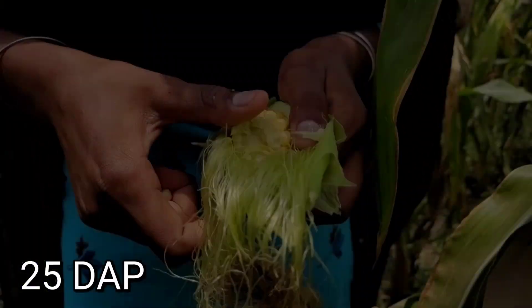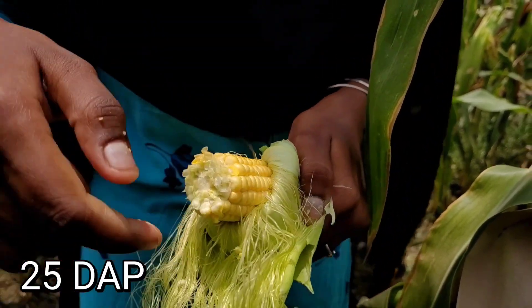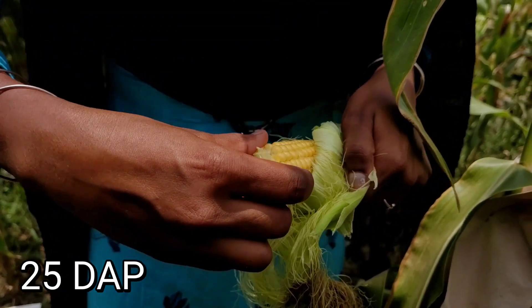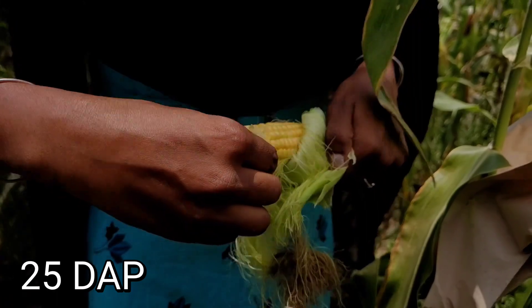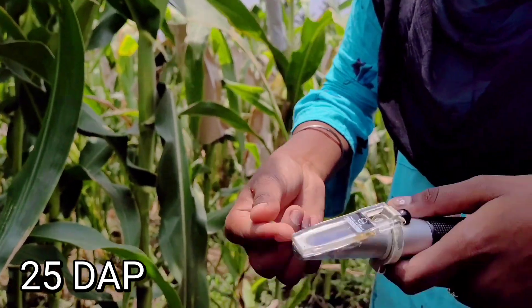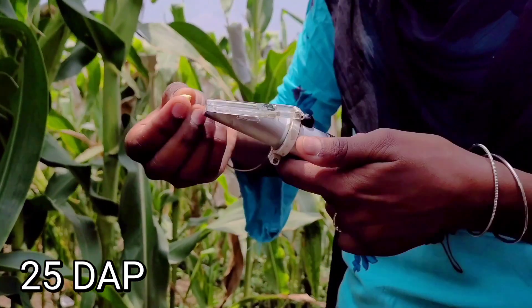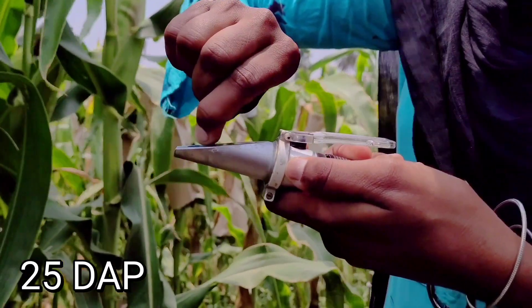Here, the kernels were collected from the cob. The kernels were pressed gently with a finger so that the clear liquid oozes out, and the clear liquid is placed over the prism of the Brix meter and kept perpendicular to sunlight. The Brix value is recorded.